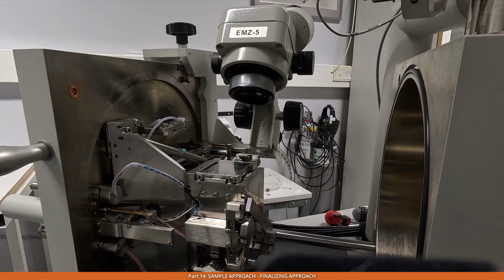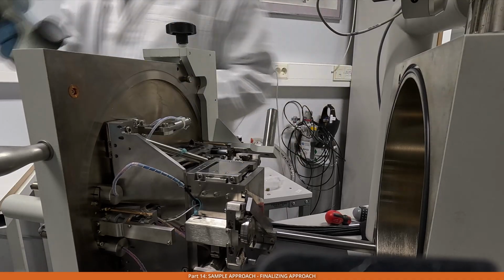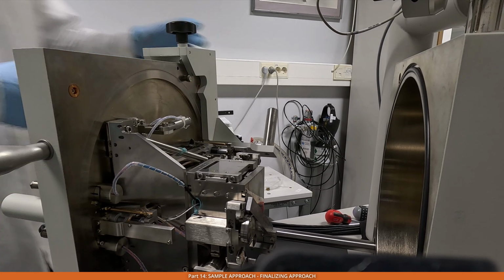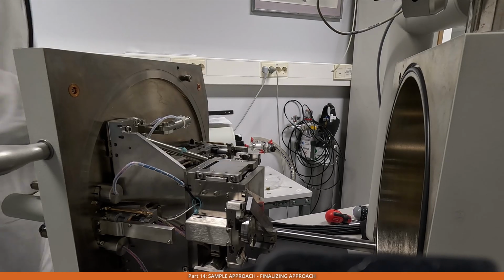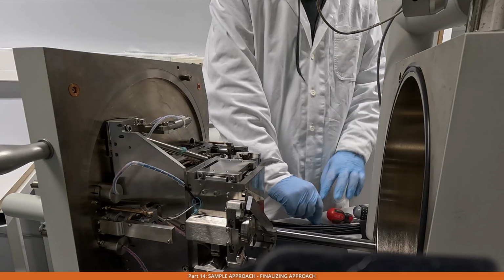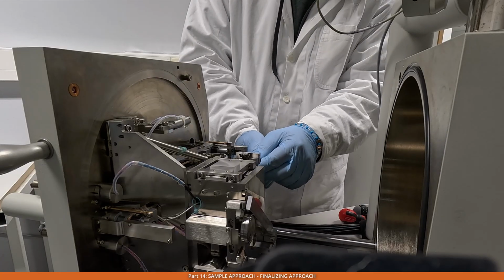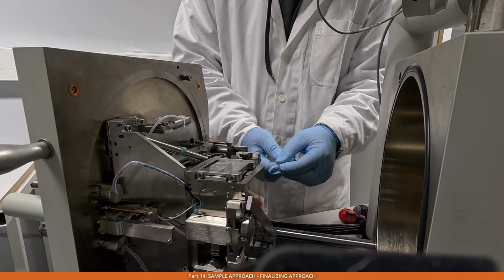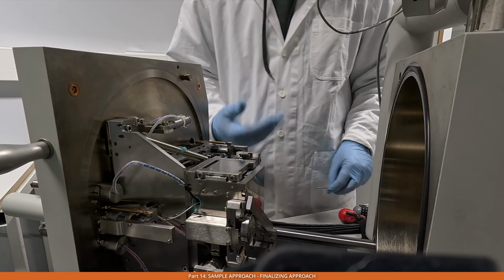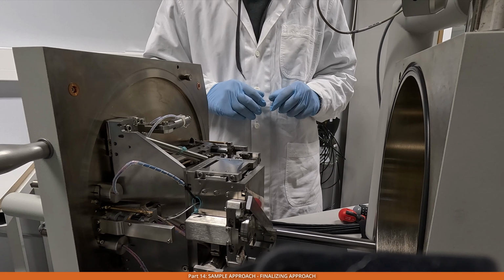We take away now the stereo microscope, put it back to the stand that we have on our preparation table. Take away this bracket. Double check that all the screws are tightened. So remember that we have at least 3 screws to check: the one screw which holds the sample, and the 2 screws that hold the stage. If one of the screws is not tightened all the way, then the cutting may not be super stable.